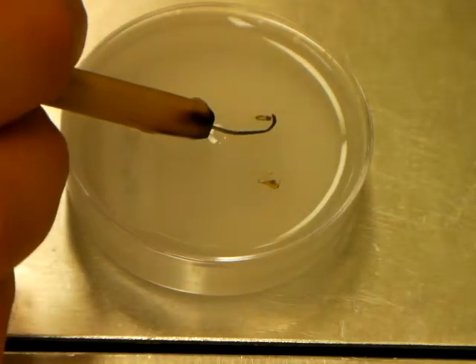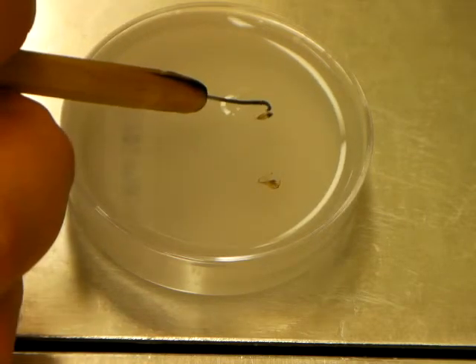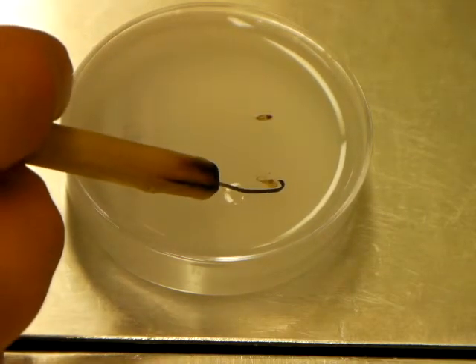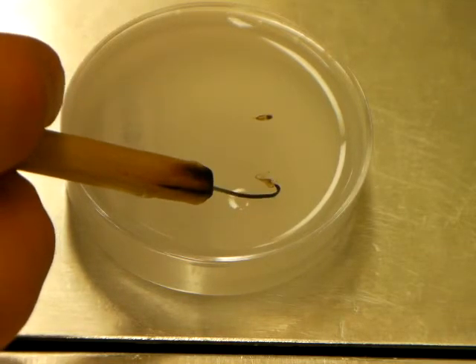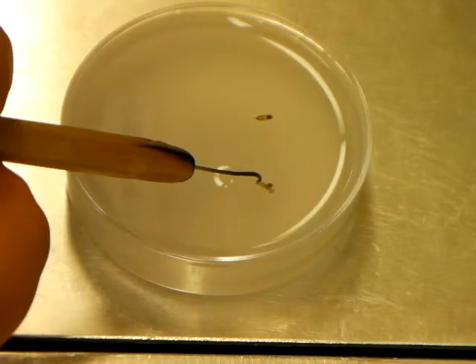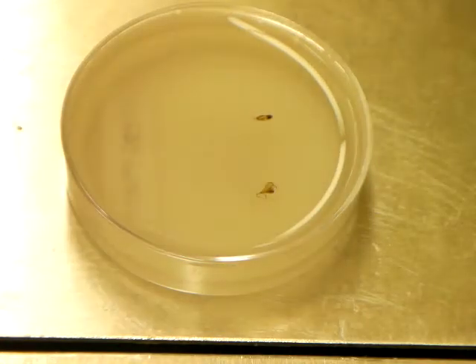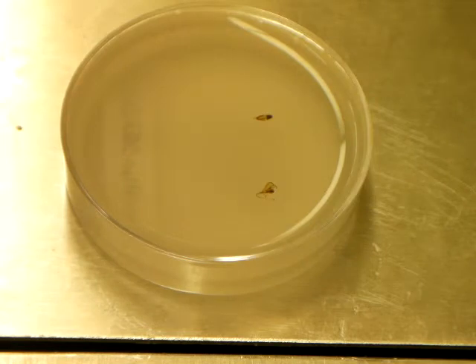And as I mentioned, the more you stay on top of moving these up as the paraffin solidifies underneath them, the less of a chance you'll have to dislodge them. It's going to leave cracks in the paraffin, which is, needless to say, undesirable. You want to be able to have nice, clean, smooth, unblemished paraffin from the top to the bottom of the casted plate by the time it's done.